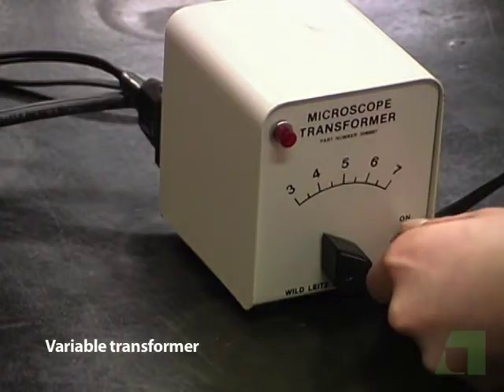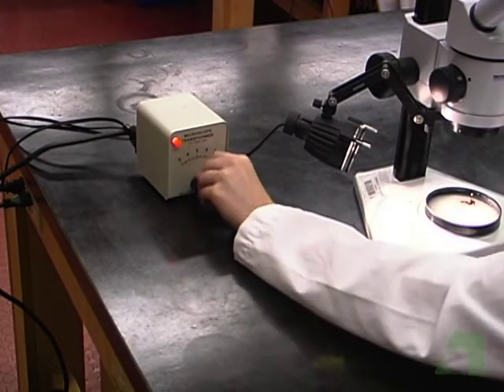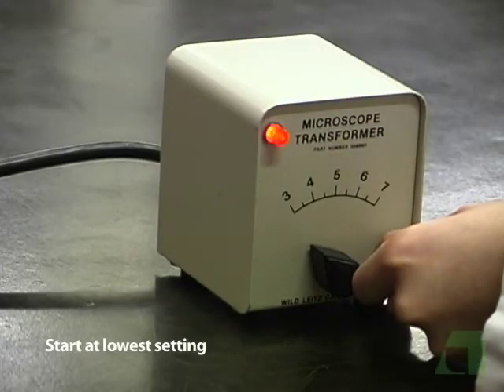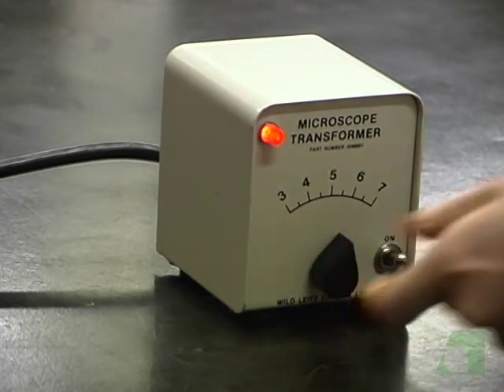Some microscope lamps have variable transformers that regulate the amount of electricity passing through the filament of the light bulbs and hence the light intensity. You should always start off with the lowest setting and gradually increase it to the point that the object is clearly illuminated and is still comfortable to your eyes.